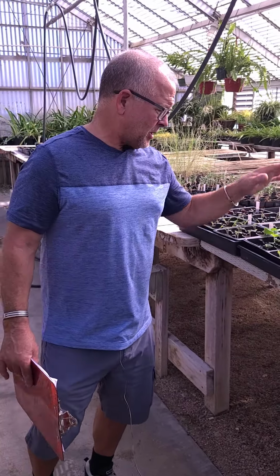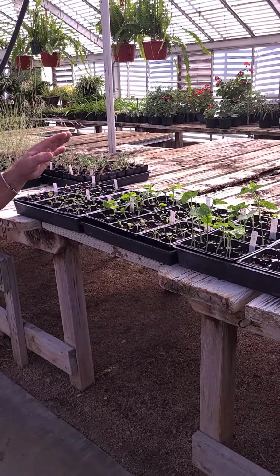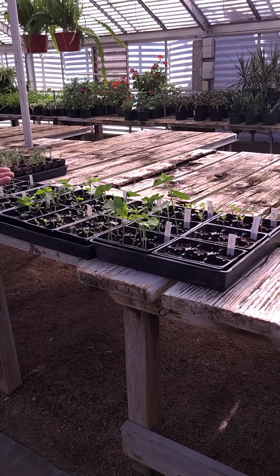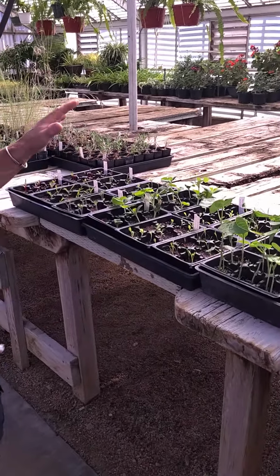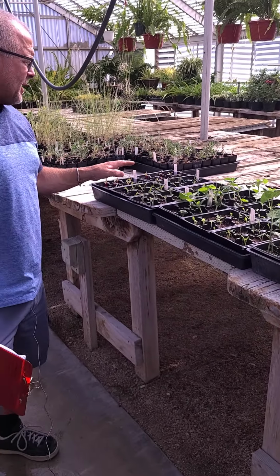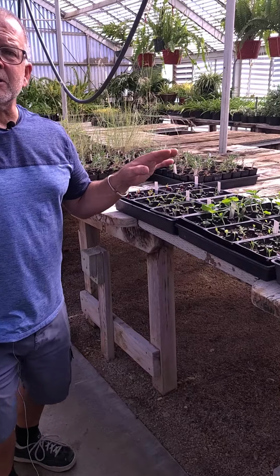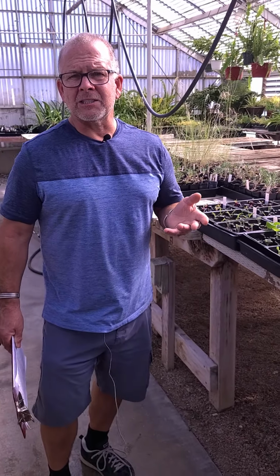So what we did was we used nursery soil. We used actually a pretty nice soil here. We didn't actually use natural soil in this. We could have; that would have been another option. But what we've done is we've grown all these plants in just good nursery mixed soil. But we've chosen plants with different tolerances to salinity. We'll do another lab exercise that actually looks at salinity too.